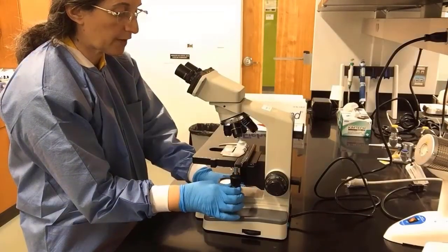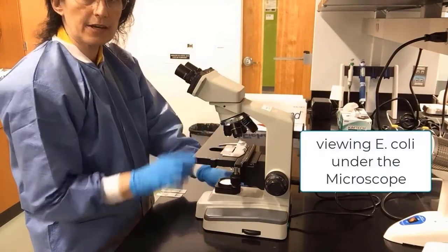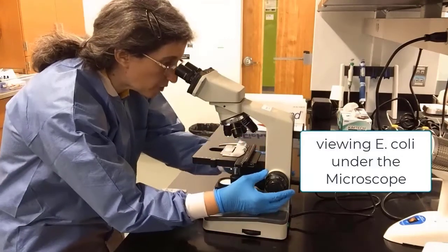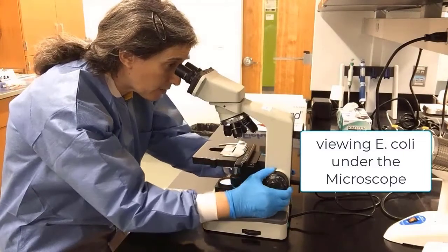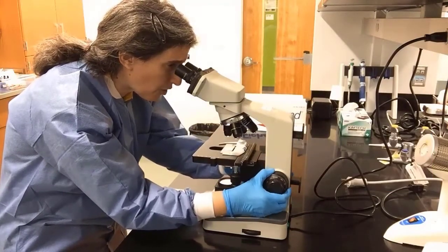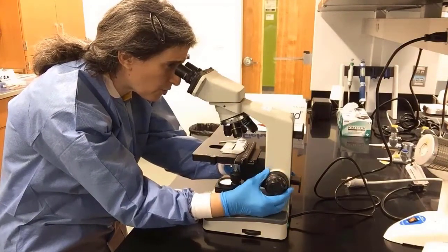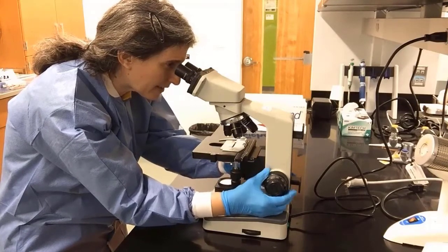We want to center our specimen so we can see it where the light comes through, and we set it at 4x. We look into the oculars, and using the coarse knob, that thick knob, we bring the stage up, up, up, until we find the specimen.